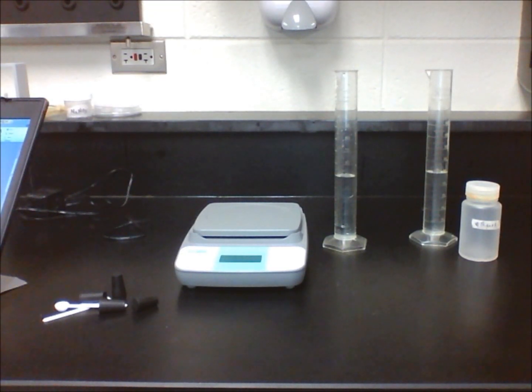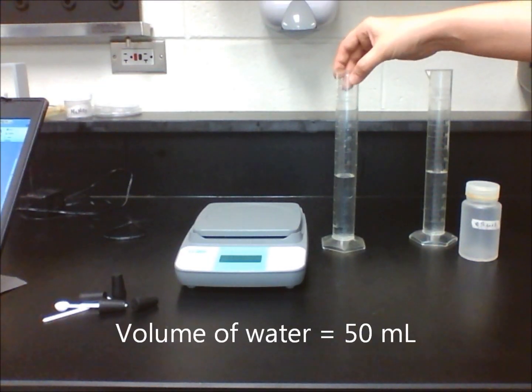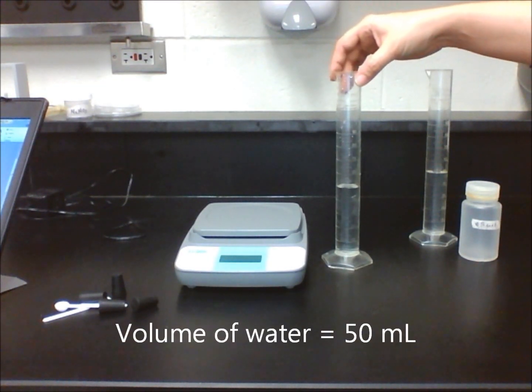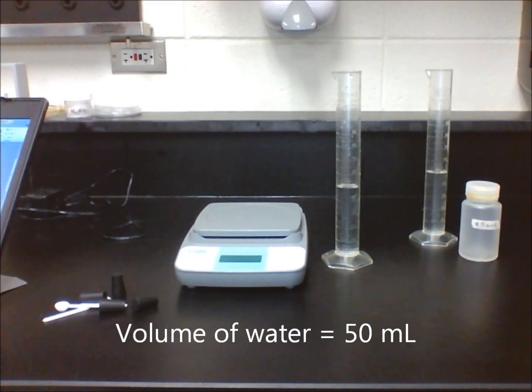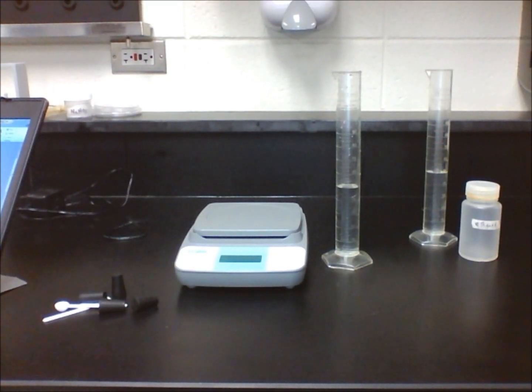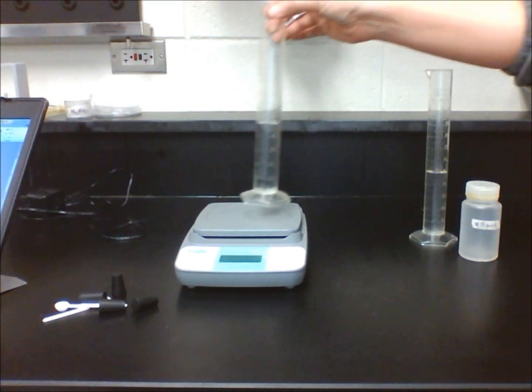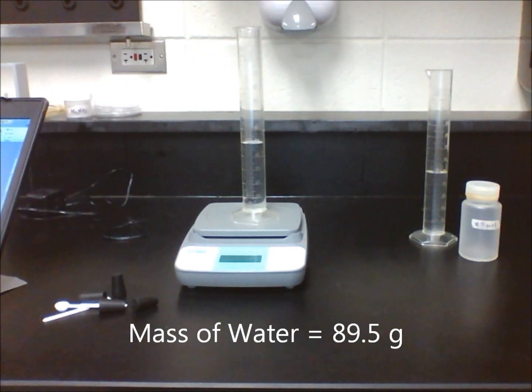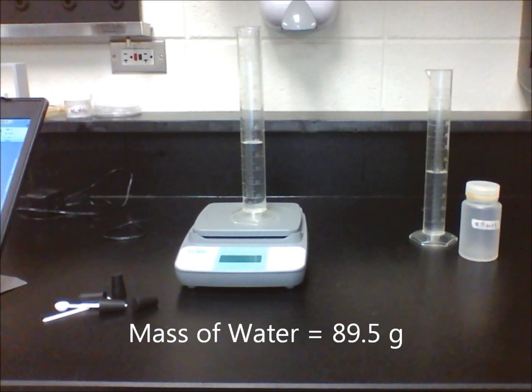Put exactly 50 milliliters of water into one of the graduated cylinders. You can use a pipette to help you get an exact amount. Measure the mass of the cylinder and its contents, and record your results in Table 1.